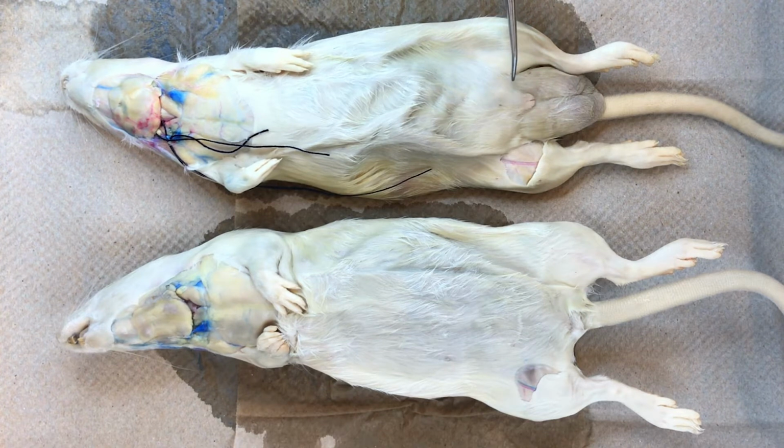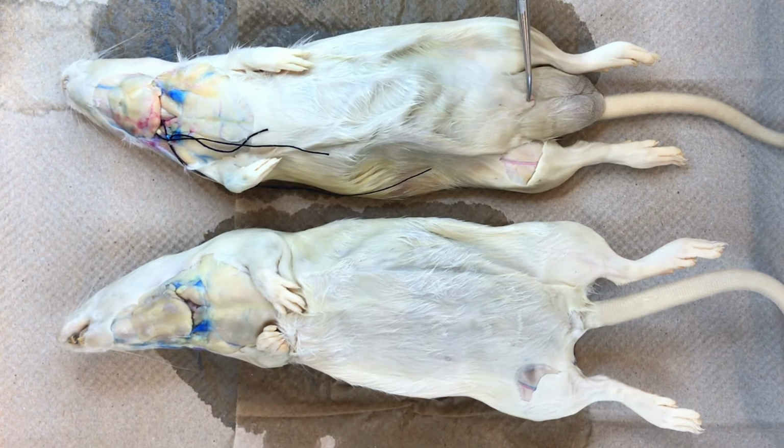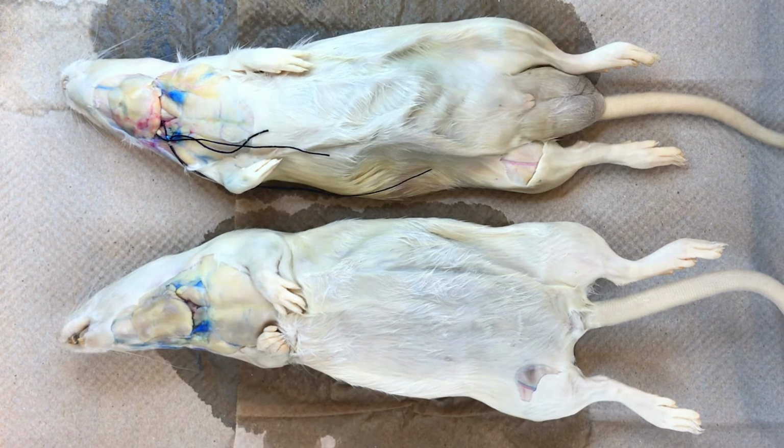Just anterior to the scrotum is the opening of the male urogenital system, terminating in the penis. It is usually withdrawn into a skin covering and can be observed more fully in the internal dissection in Unit 8.